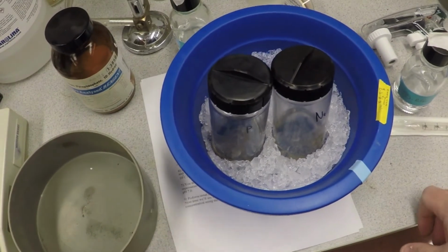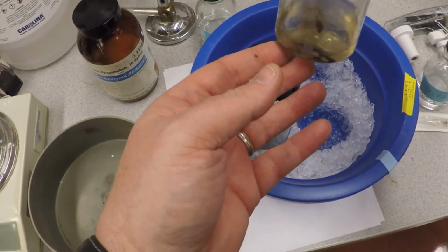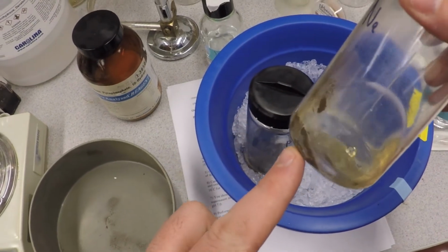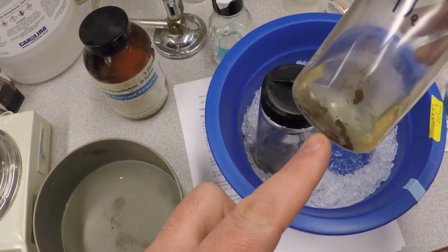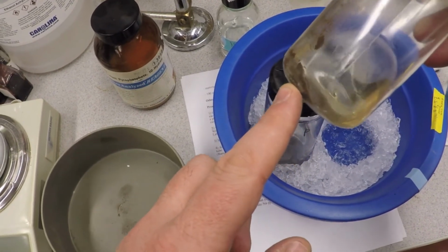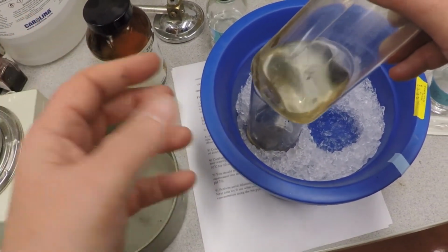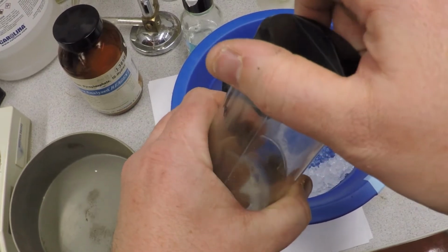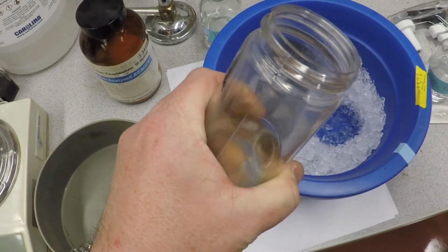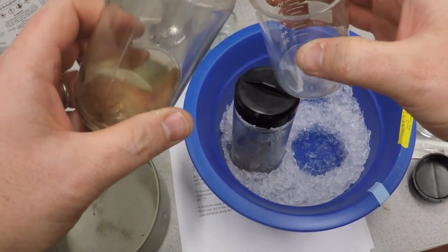Okay, so I pulled them out of the centrifuge, put them on ice, and I don't know if you can see this too well, but that's my pellet. Okay, not terribly exciting. But that should have now in there bacteria, because this is after the high-speed spin. And this liquid, the supernatant, we just want to get rid of. Okay, so I am just going to decant this very carefully into a container. You could use the sink. Okay, I'm just going to decant it into here because it's easier on the camera.